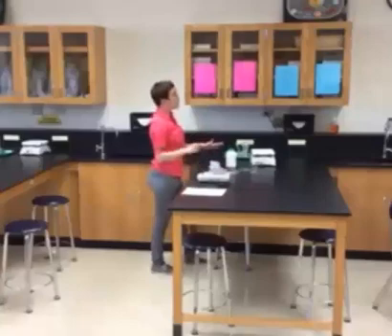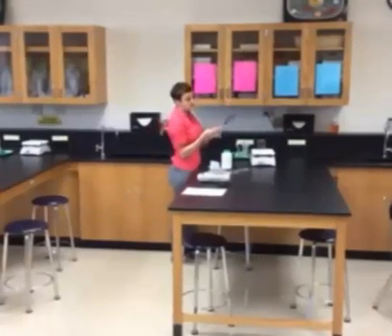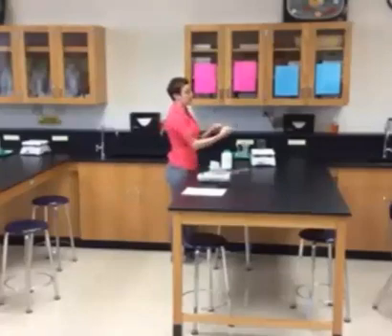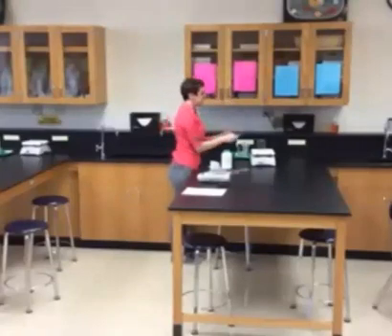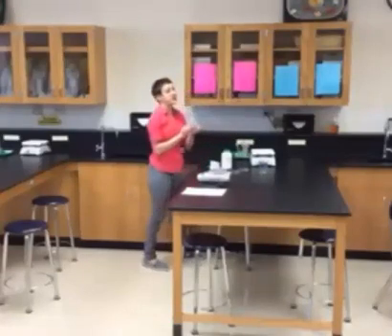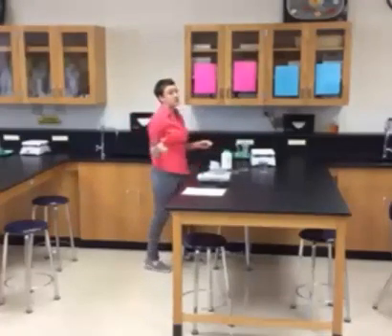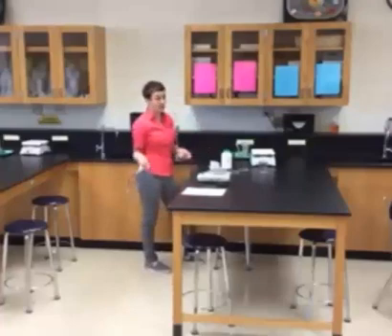When the water is done boiling on the hot plate, please use these beaker tongs with two hands. The part where it's indented should fit tightly around the beaker. Please use two hands to transfer it — even my hands don't separate enough to safely hold the beaker without the possibility of dropping it.